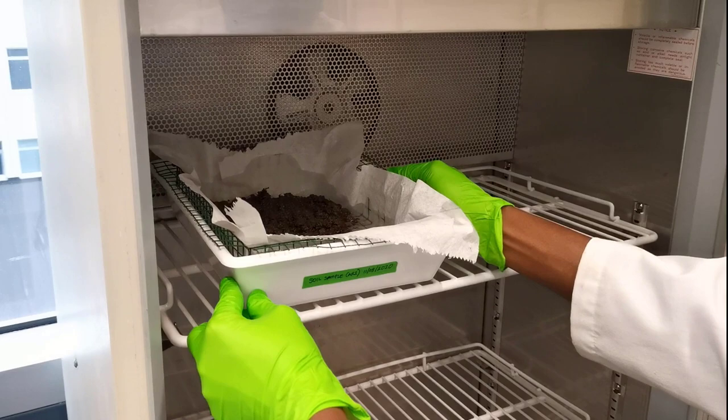Leave the extraction tray in an incubator at room temperature for at least 24 hours, after which you can collect the nematode suspension.